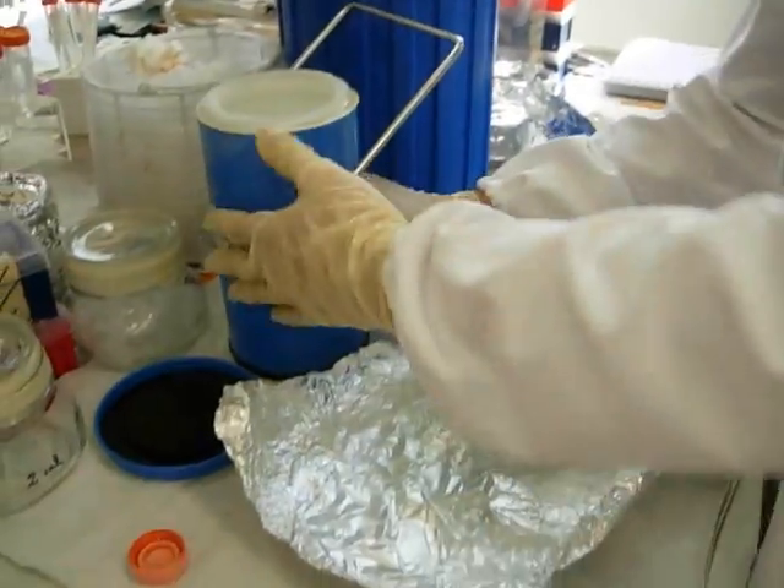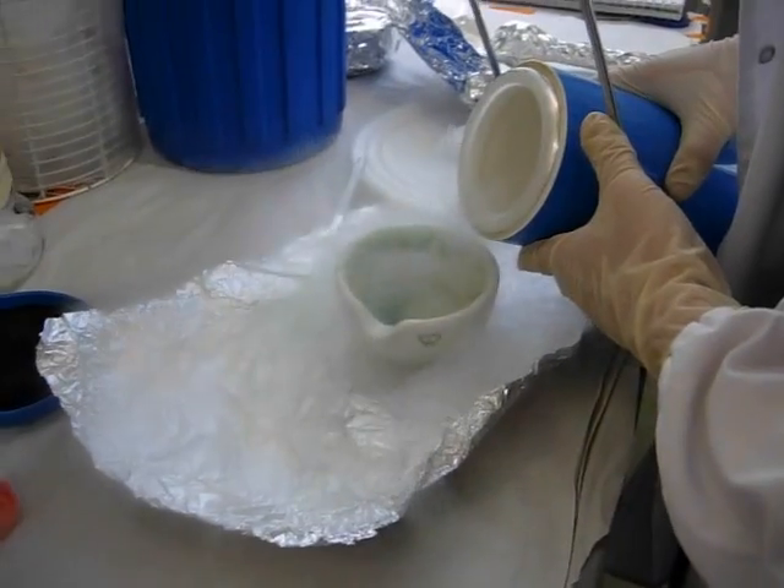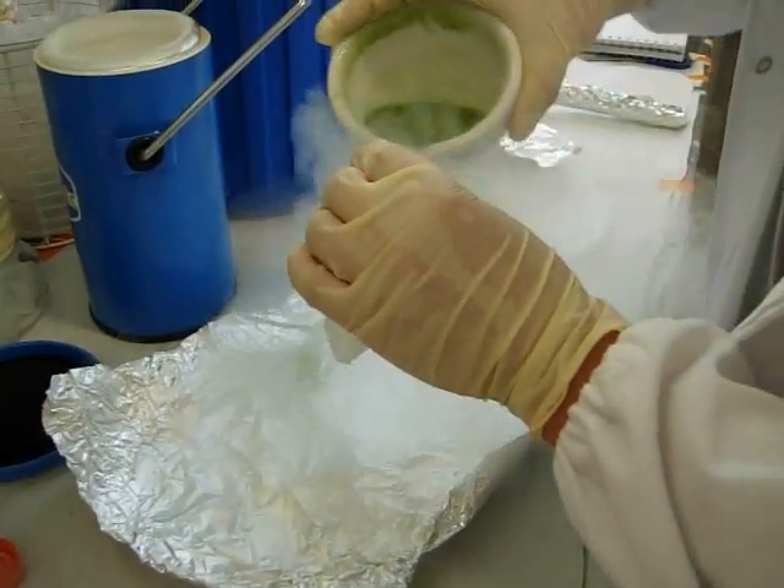So I pour again — that's the example I'm going to extract. But as I said, we're making some reserve in case we need to repeat the extraction.